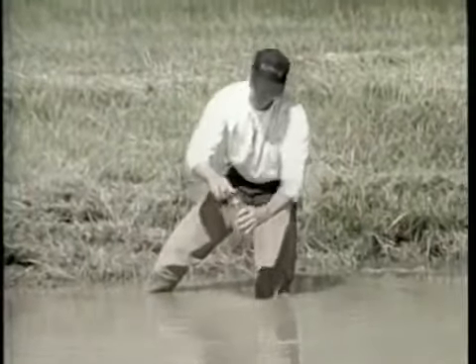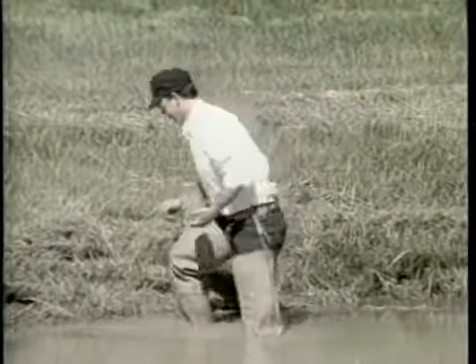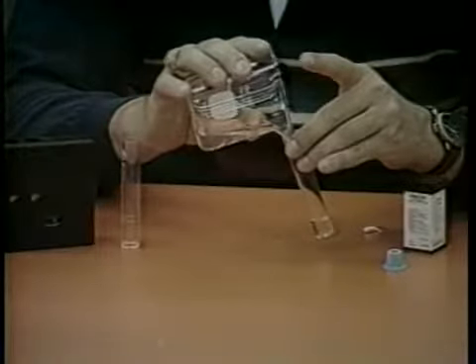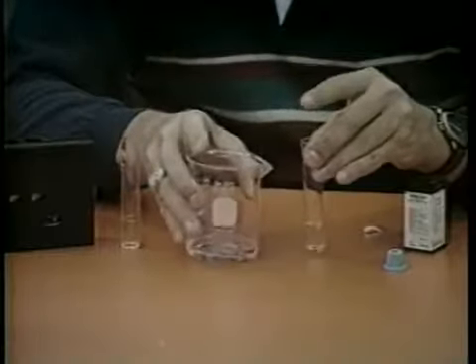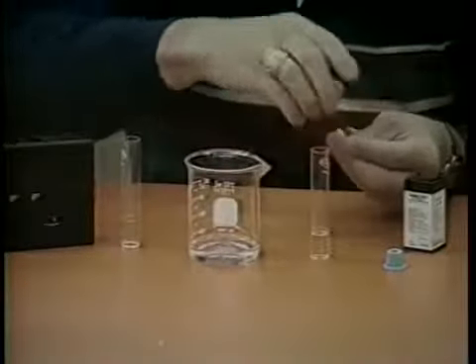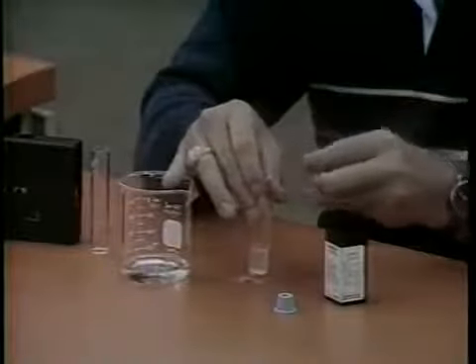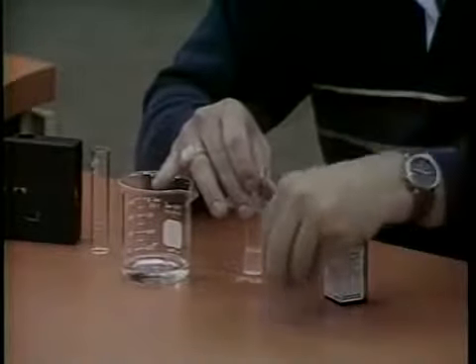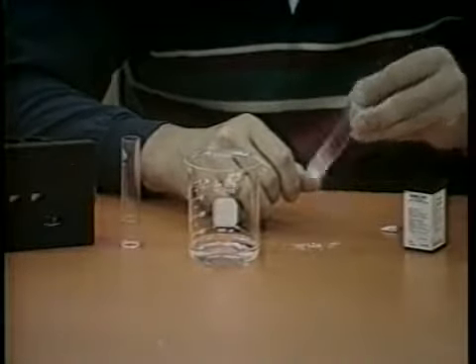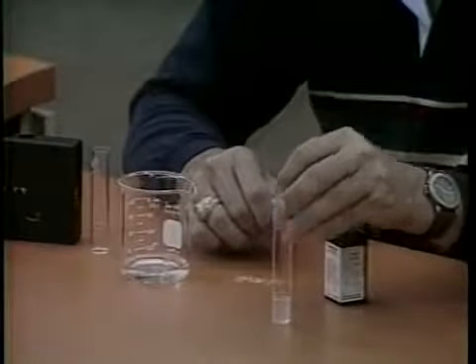Collect a water sample in a clean jar or bottle away from the pond bank. Remember, always use a clean container for sampling. Rinse the color viewing tube several times with the water sample. Fill the tubes to the 5 ml mark. Add 1 nitrite reagent powder pillow to the tube, then stopper and shake to mix for several seconds. A pink color will develop if nitrite is present. Allow the sample to stand for 10 minutes.